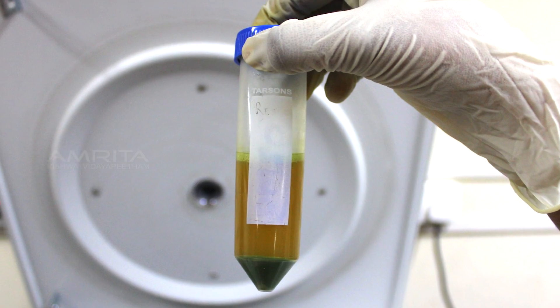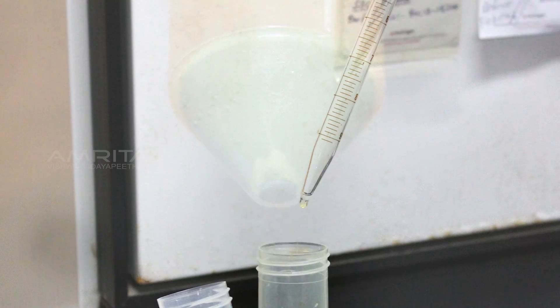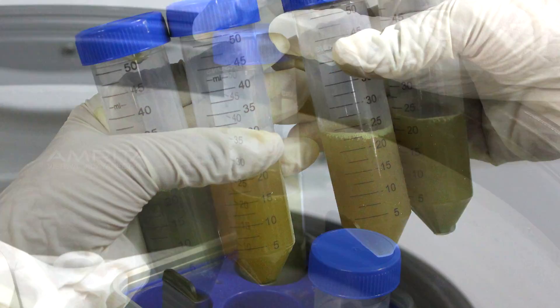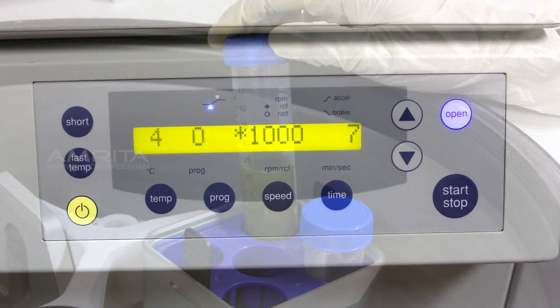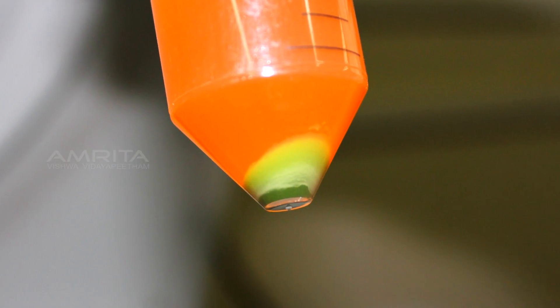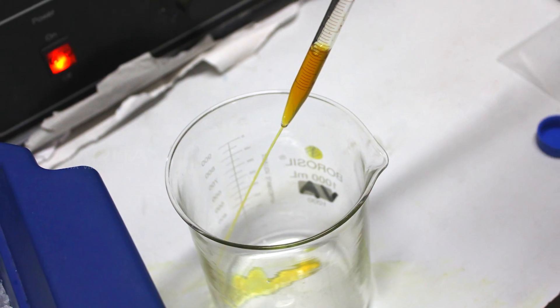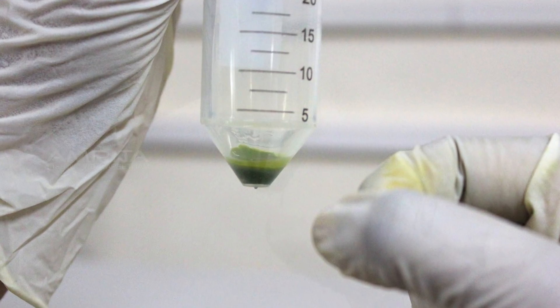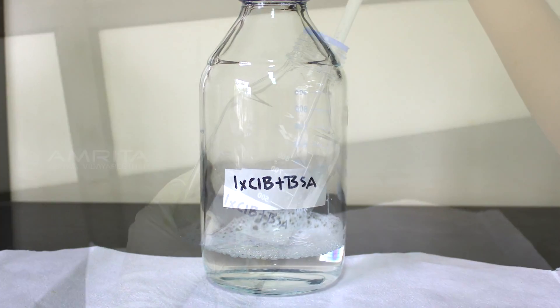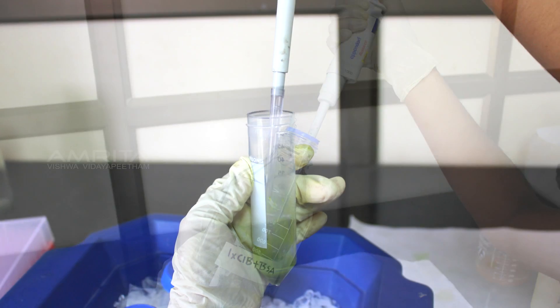You will obtain a white pellet. Transfer the supernatant into chilled 50 ml centrifuge tubes and centrifuge at 1000xG for 7 minutes. You will obtain a green pellet. Discard the supernatant and break the green pellet by gently tapping the tube with your finger.